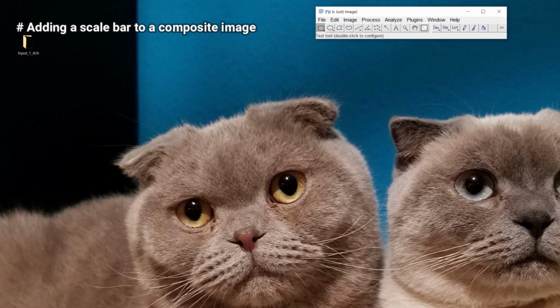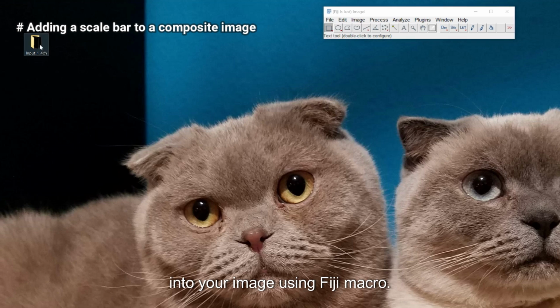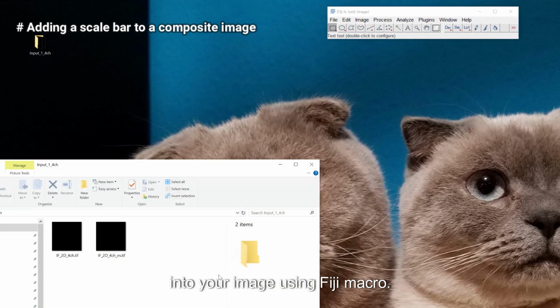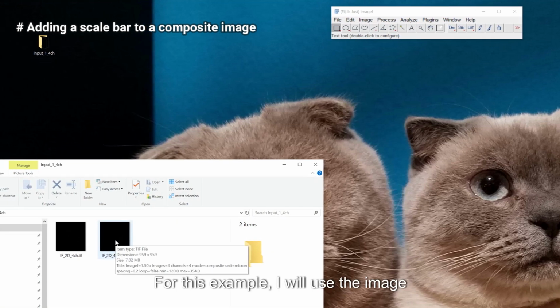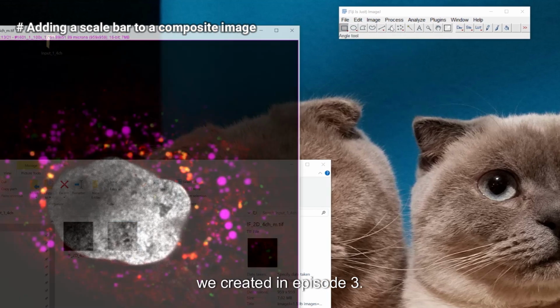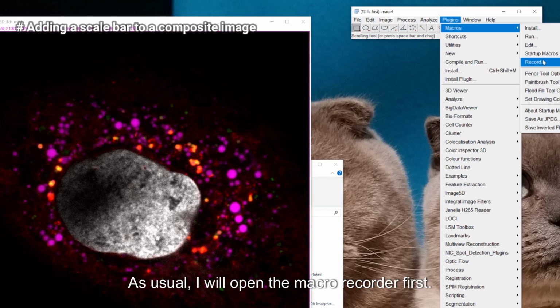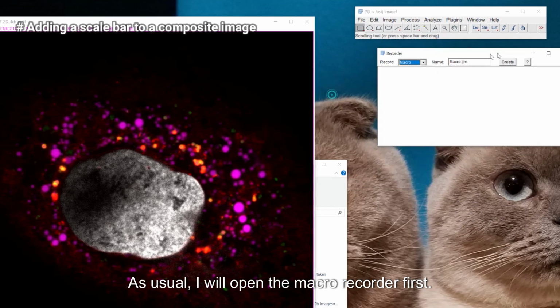Hi everyone! Today I will show you how to insert a scale bar into your image using Fiji macro. For this example, I will use the image we created in episode 3. As usual, I will open the macro recorder first.